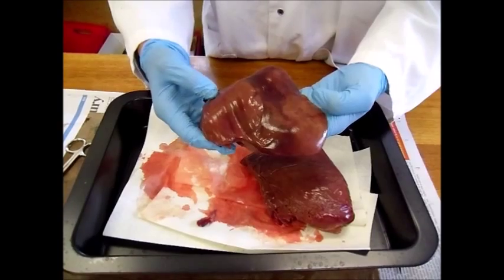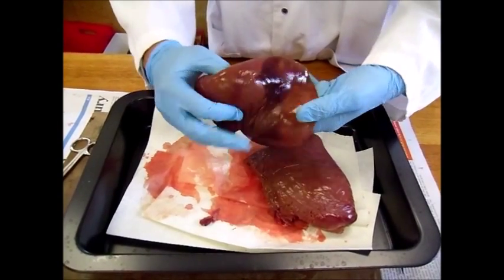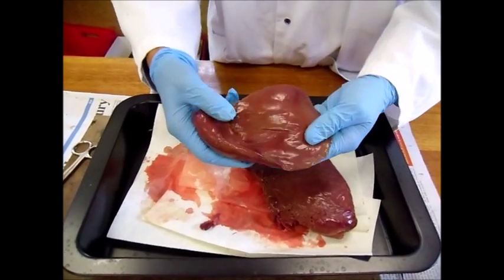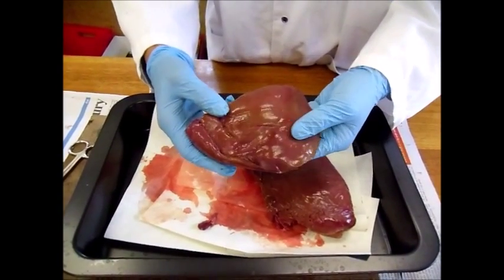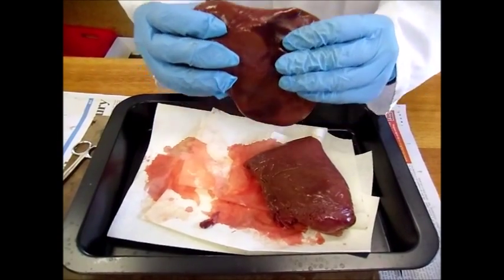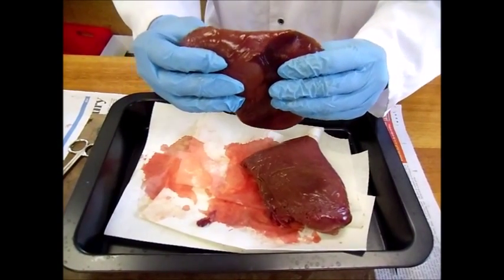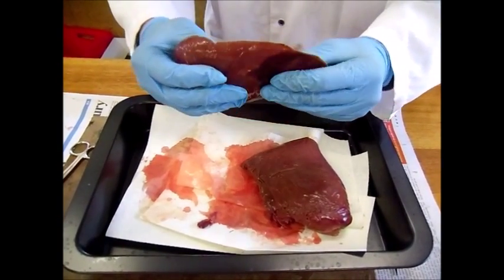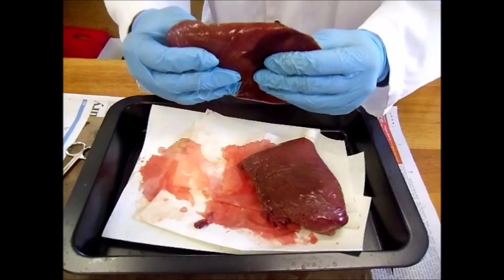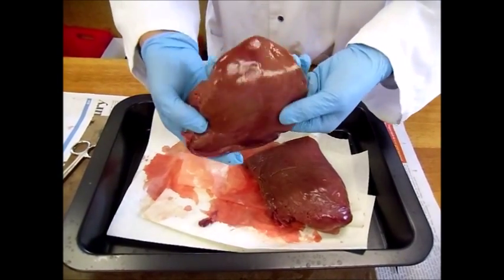Excess glucose is stored as glycogen. When the muscles require more energy, the liver can convert glycogen back into glucose that is transported to the working muscles via the circulatory system.